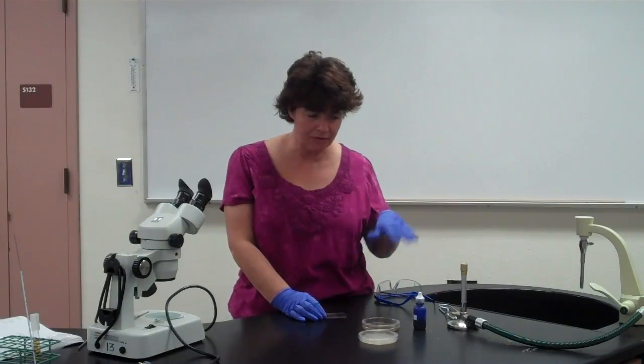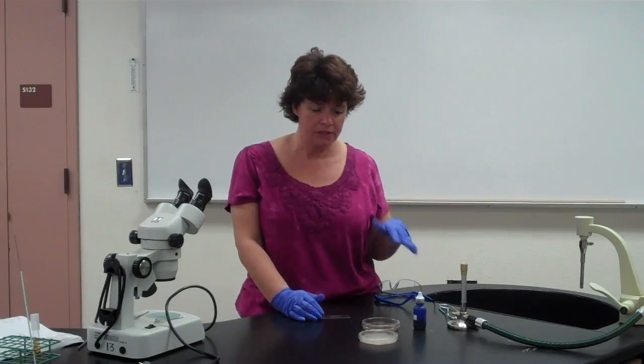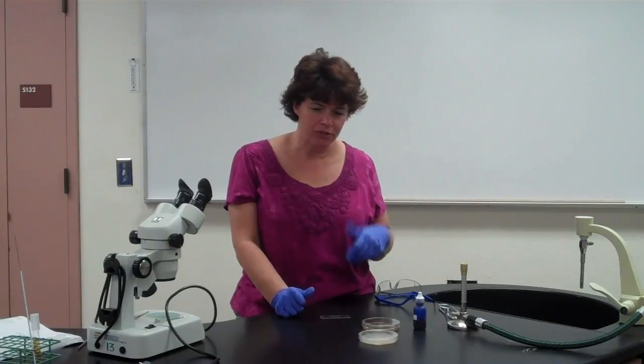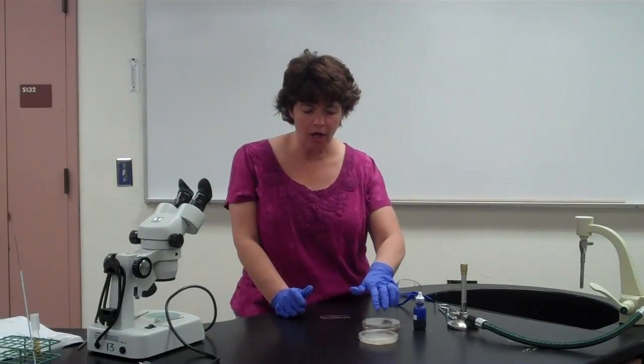Okay, so even though this is in one video, it's going to go over a 2-week period, so you might have to watch this video a second time next week just to make sure you're doing all the procedures. So the first week, all we're really doing is inoculating that first plate.